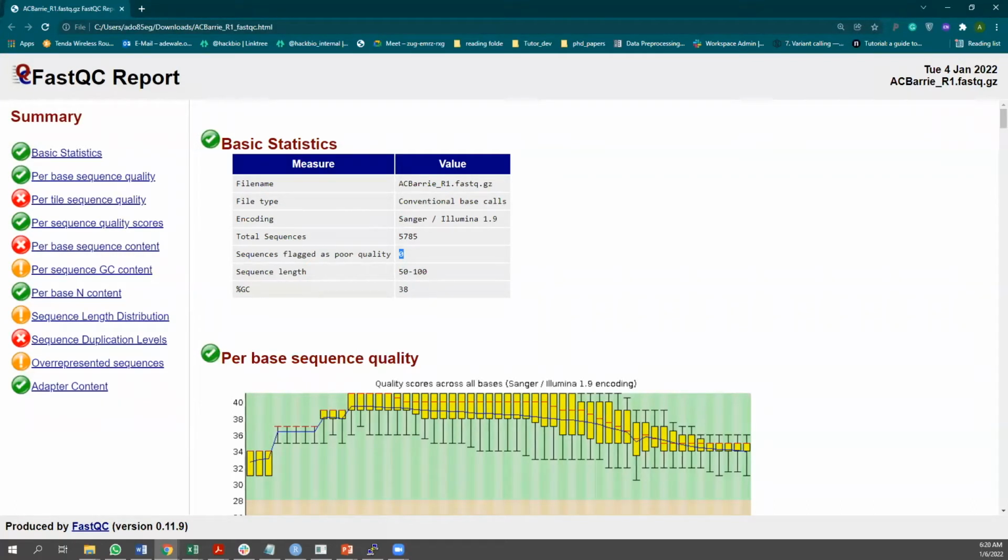You should be warned that the thresholds used to assign these flags are based on a very specific set of assumptions that are applicable to a very specific type of sequence data. They are tuned for whole genome datasets, shotgun DNA sequencing, and they are not so reliable for other kinds of sequencing data types. Therefore, a module result that has a warn or fail flag does not necessarily mean that the sequencing run has failed. Please take note of that.